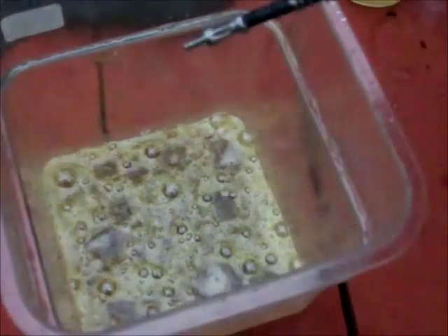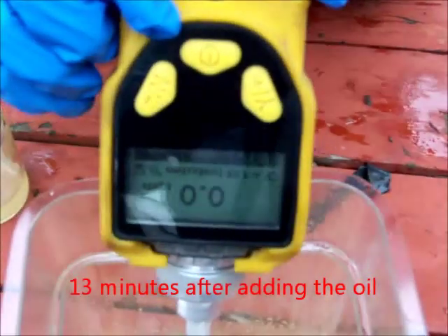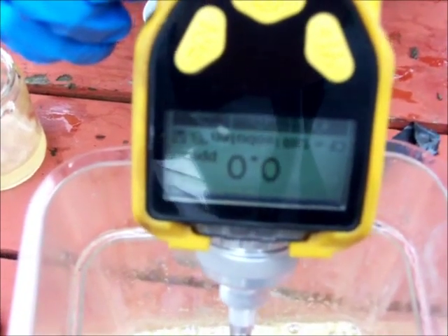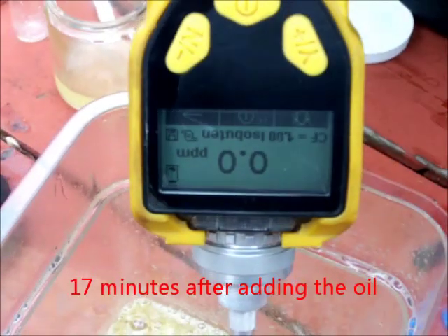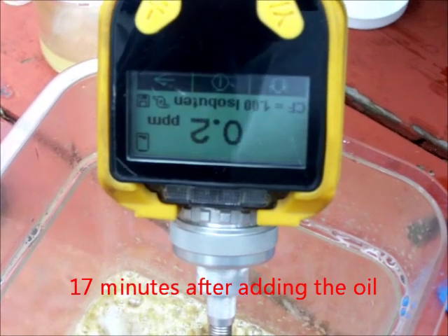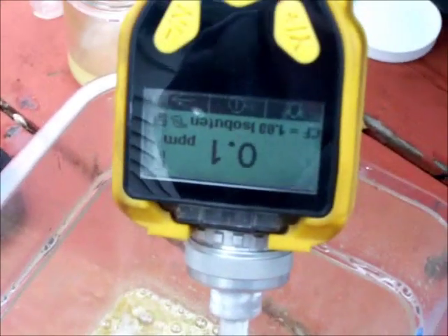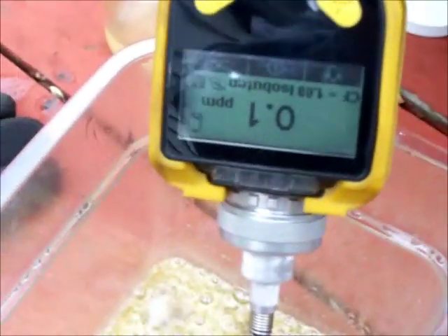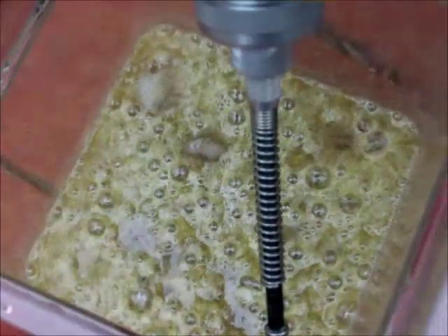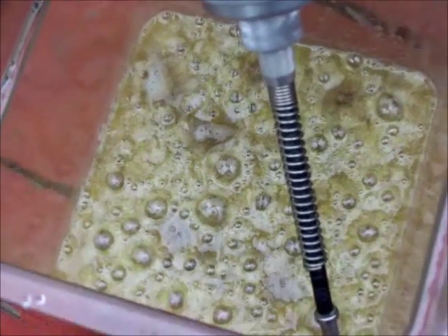Now we are going to test this solution. As you can see — 0.1, 0.2. Though it's not a lot, it is giving off some volatile organics. We will check back in on this again later.